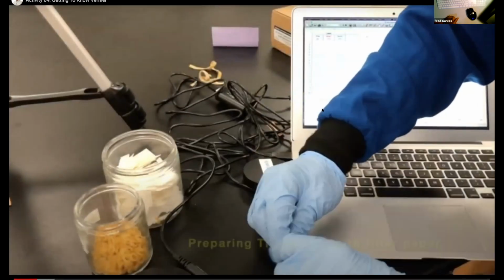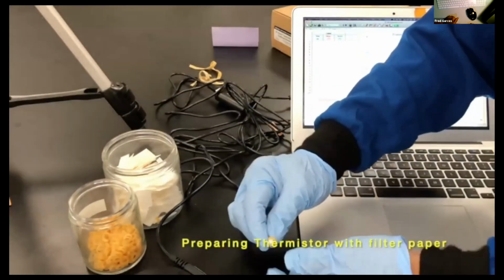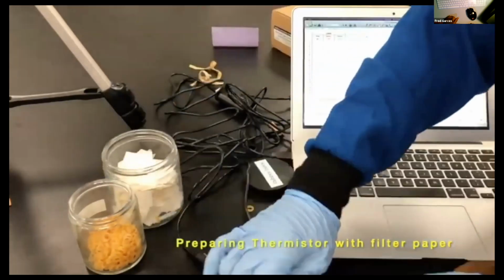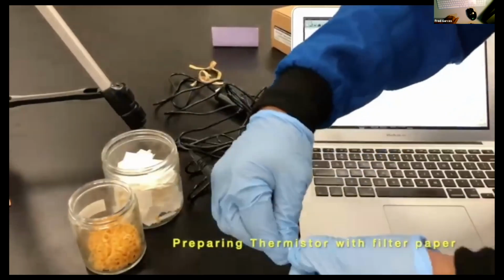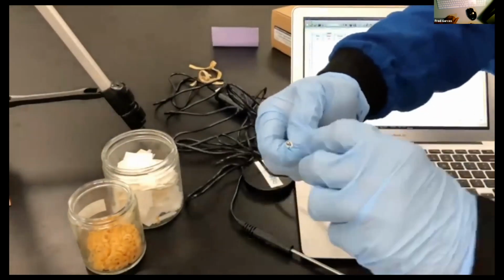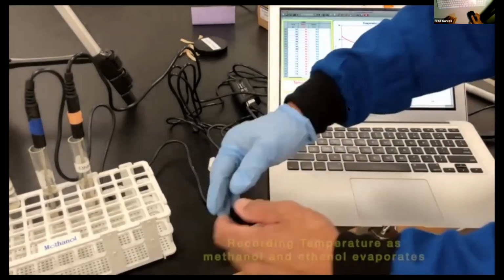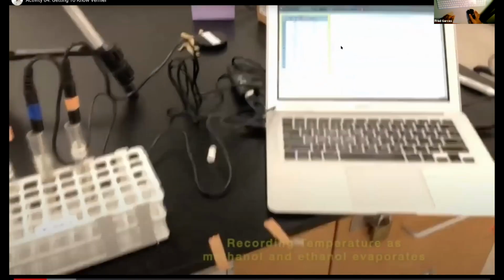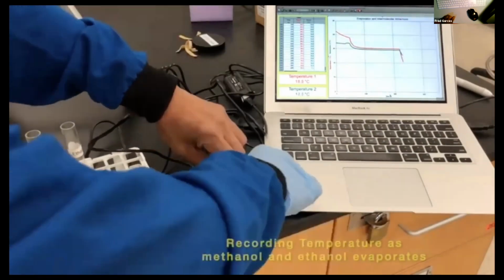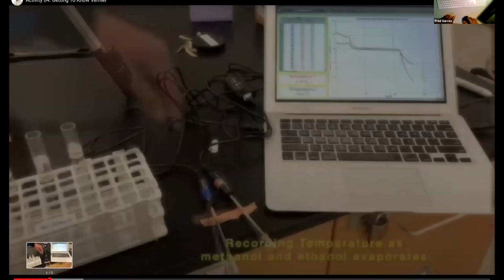So here's me in fast forward, because I don't want you to just sit there while I do this 3 or 4 times, because it was very difficult to put the filter paper on with that small rubber band, with those rubber gloves. Anyway, here it is. What I'm doing now is I turn on the instrument and let it run so that it equilibrates at room temperature. Then, let me go back. The neat thing about this is you can always go back.